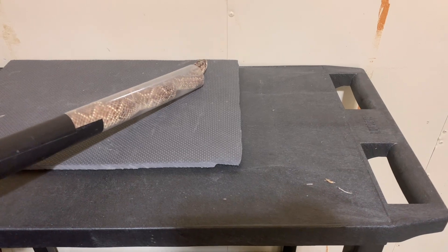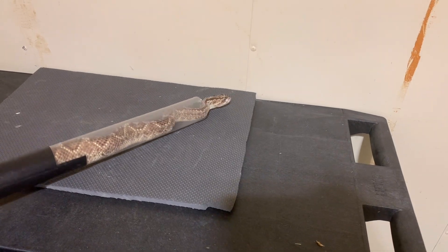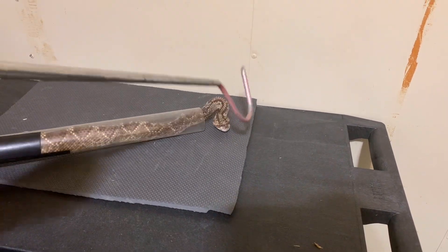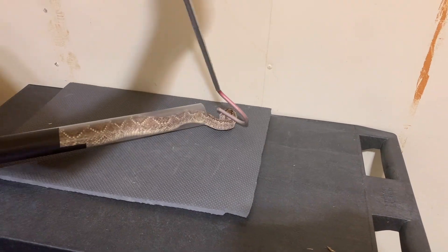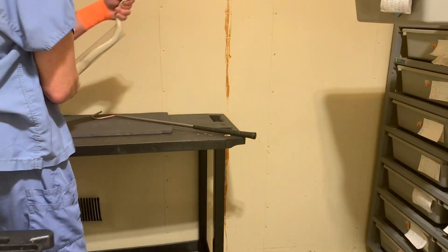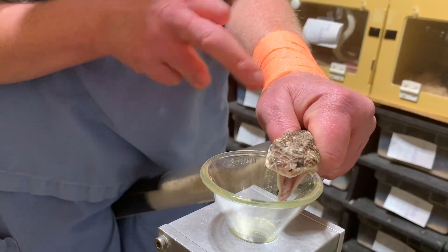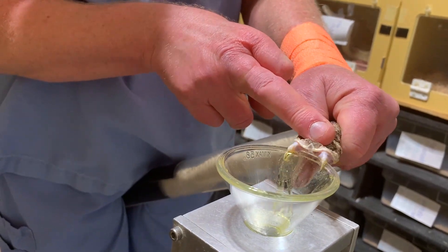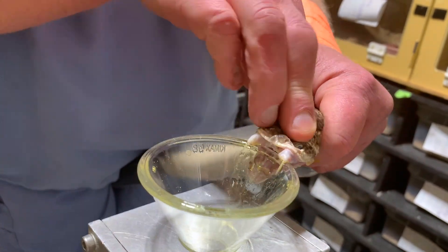She's all curled out — this snake is keeping her head kind of in the tube, and the reason for that is she's trying to protect her head in there. But if Jim tries to put his hand down on her neck right by the tube, she can really pinch his fingers in between her jaw and the tube, which doesn't feel good.